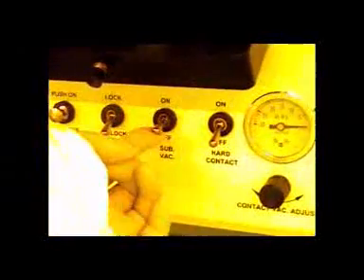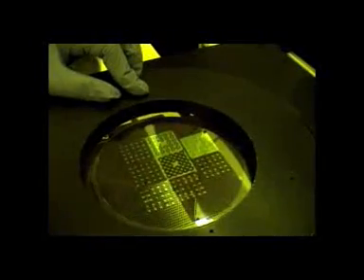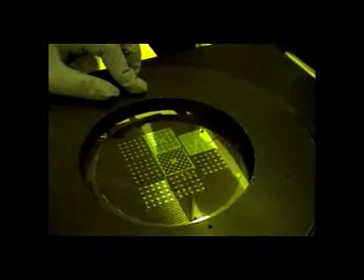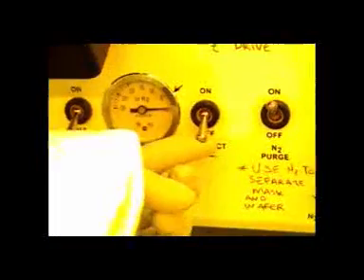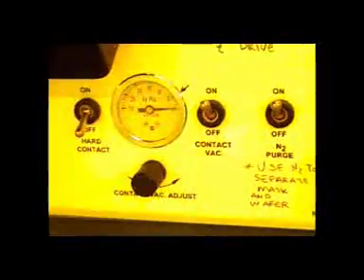Open the stage and load in your soft baked wafer with the flat side facing you and align it to the small metal nubs on the back of the chuck. Close the stage and make sure that the ball vacuum is unlocked. Then turn on the substrate vacuum. Adjust your Y and X axis knobs to center the chuck underneath your mask. When it is all centered, use the Z axis to bring the wafer up. Do not overturn the Z knob. Watch contact occur as the wafer approaches the mask. You'll be able to feel when you have turned the Z axis to the maximum. After it's in contact, turn on the contact vacuum.